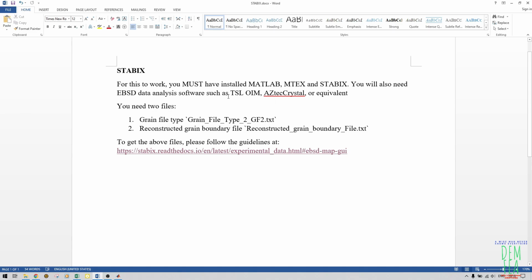Also you must have TSL software, or any EBSD data analysis software, so that you can generate these two files here: grain file type and also reconstructed grain boundary file. These two files, you obtain them from your raw scanned EBSD data file. I can assume that if you have a raw scan file of EBSD data, you must have an analysis software. I don't know if Aztec will work or any other software, but in my case, I've used TSL, which I have obtained access to through my university.